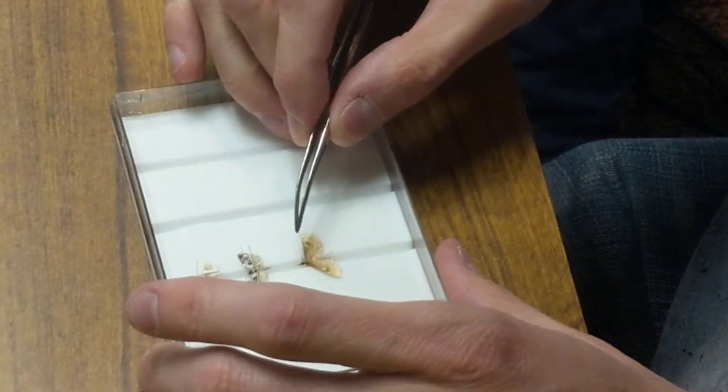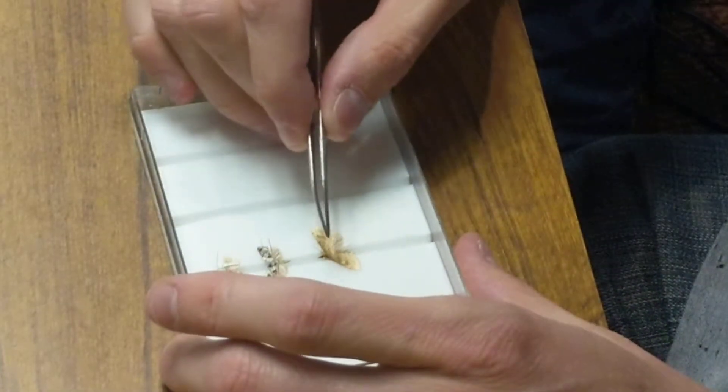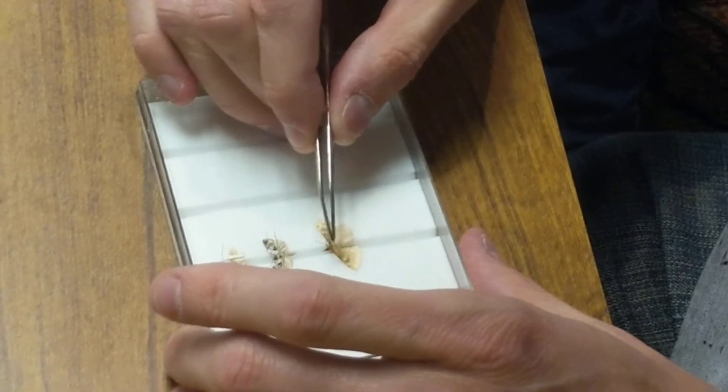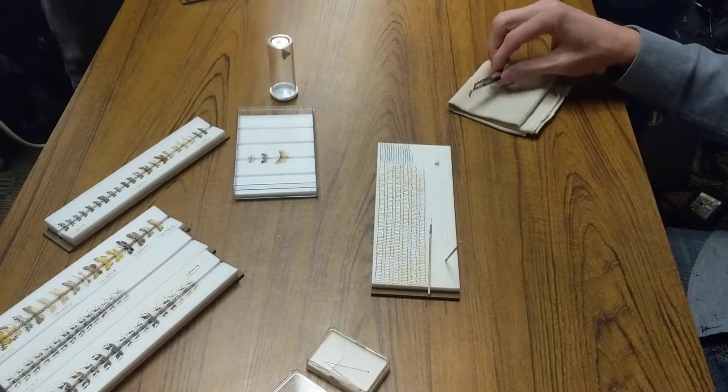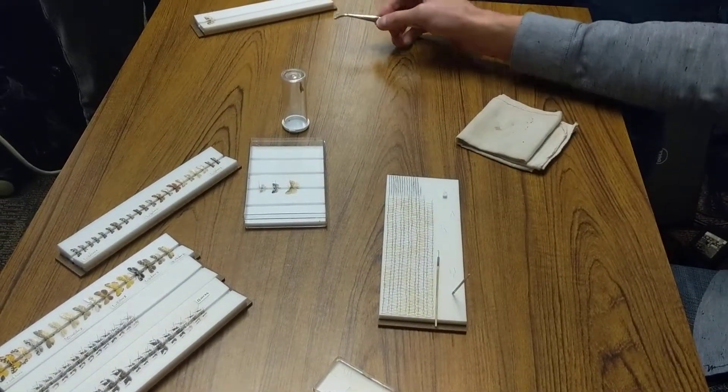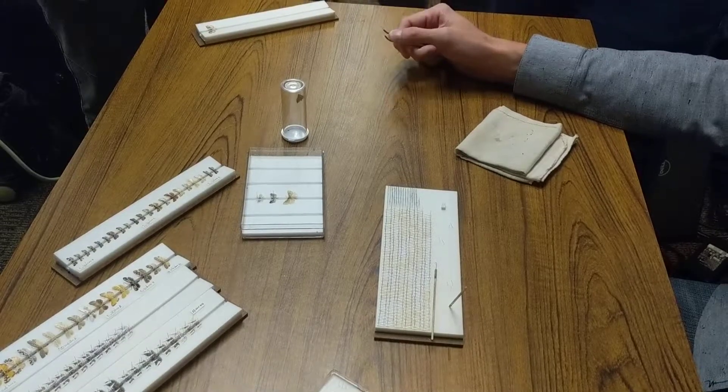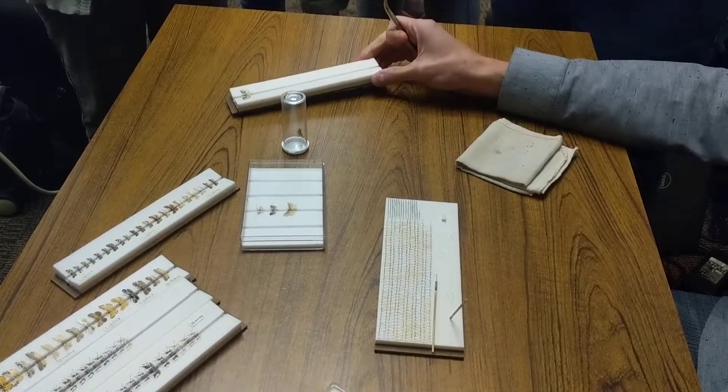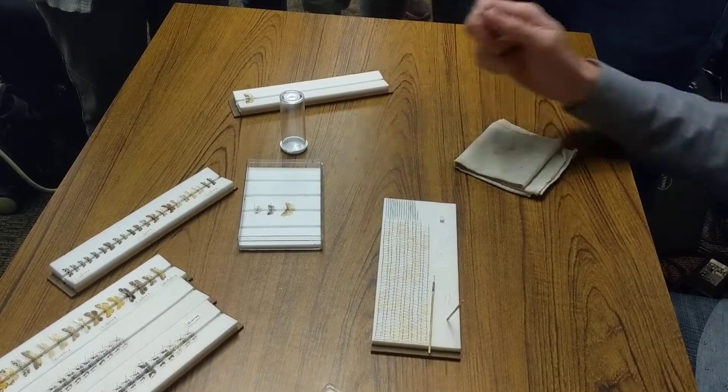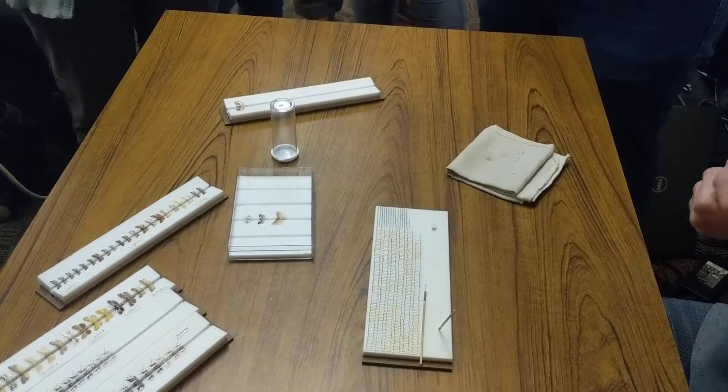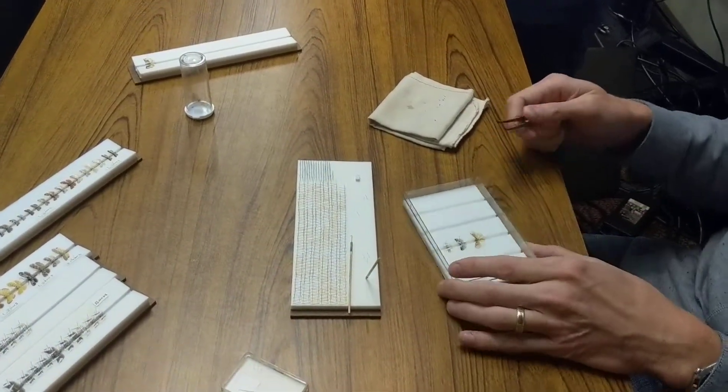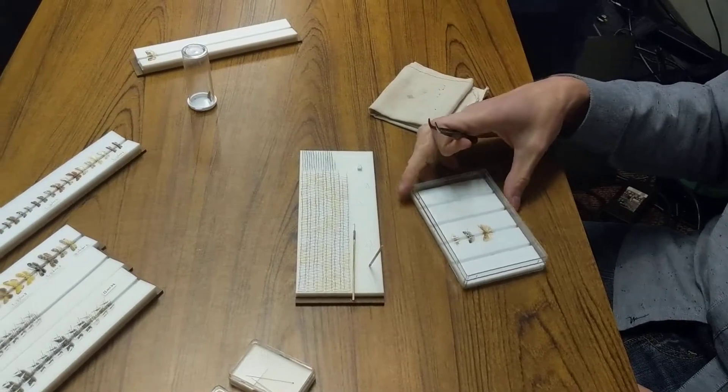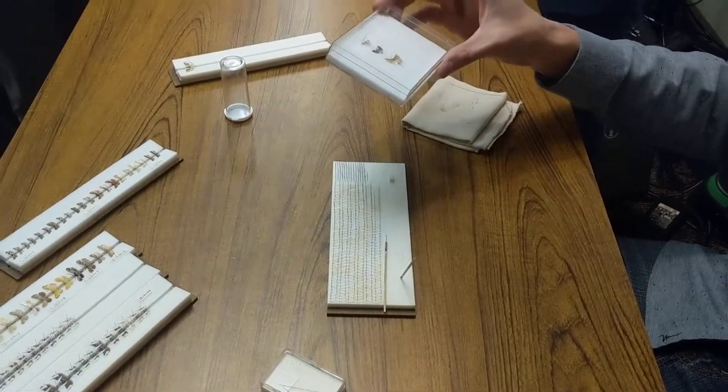You don't even need to go that far. It just sort of depends on what you're doing, like Chris said, what your end goal is, and where you are. If we're in the tropical rainforest of some exotic country, it's better to have all the specimens like that than like that. I'd rather sample everything than leave a bunch of them there and bring home ten nice ones. I'd rather have a hundred that look like that. And as long as you get the wings spread up a little bit, it's good enough because you can always deal with it later. If you just leave them like these tortricids with the wings folded up, it's really hard to deal with later.